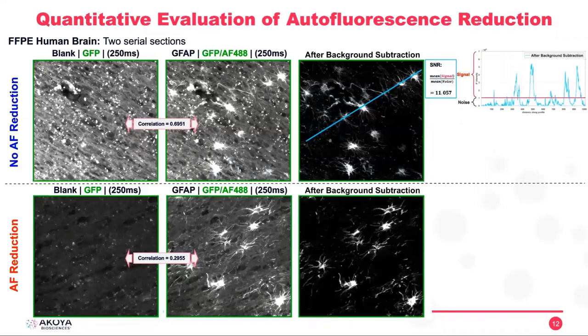And when we do the background subtraction again, we get this image here. And as you can see, we lost those high intensity small points that we were seeing there. And if we measure again the signal to noise ratio, or we look at first the intensities along this line, we can see that all the background that we are seeing here is mostly flat. The values got very, very low. And all the peaks that we have correspond to the real signals.